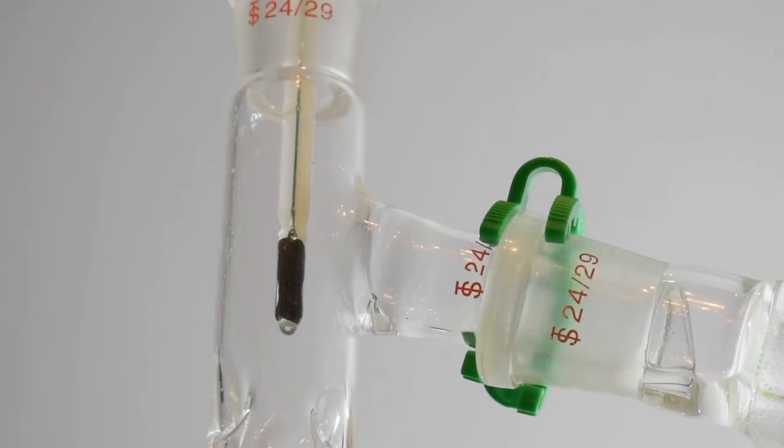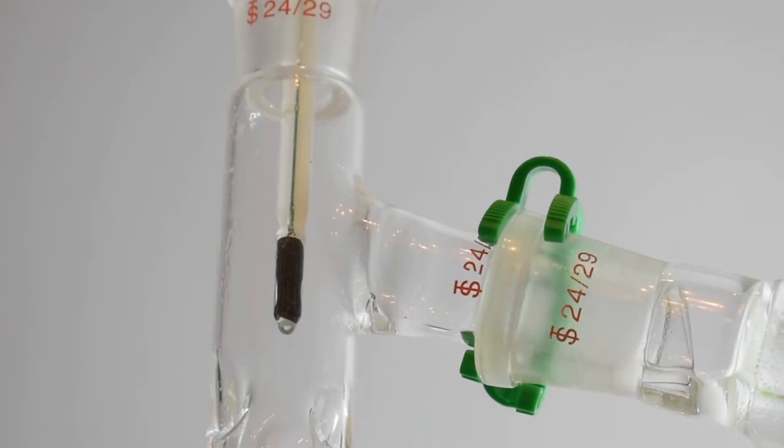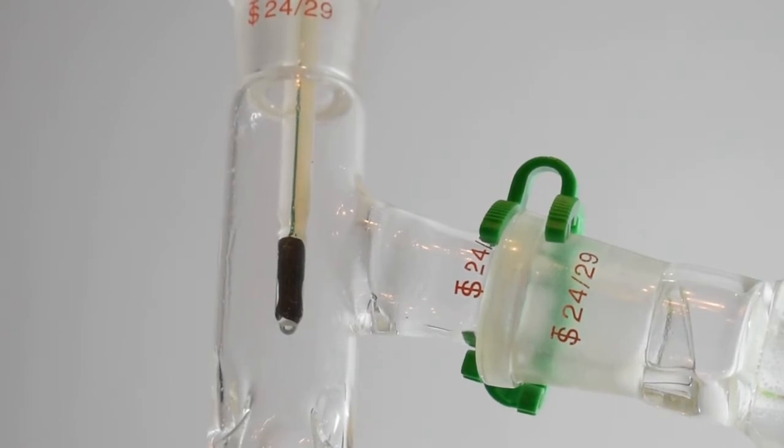It was worth noting at this point as well that the strong smell of the glacial acetic acid has completely gone. This is most likely due to the fact that we used a high excess of ethanol to push the equilibrium of the reaction to make ethyl acetate towards the product side of the equilibrium.